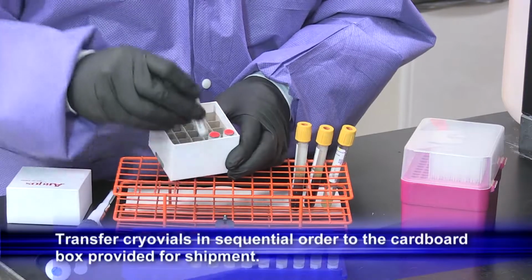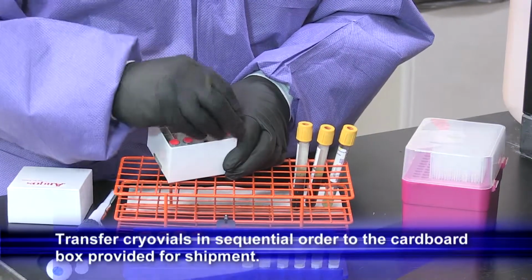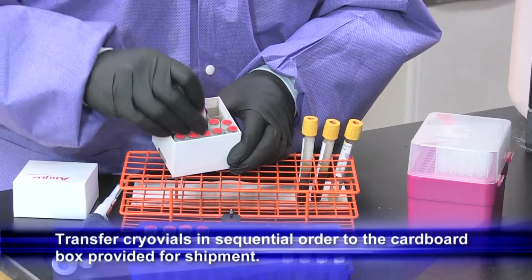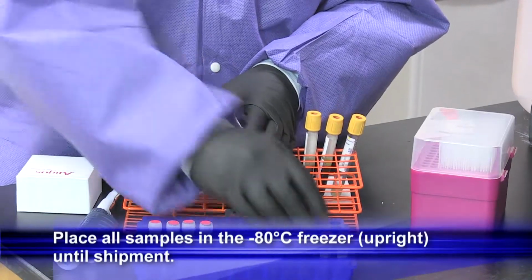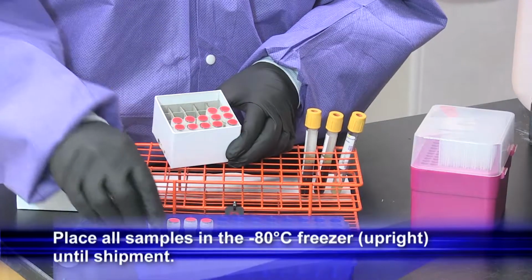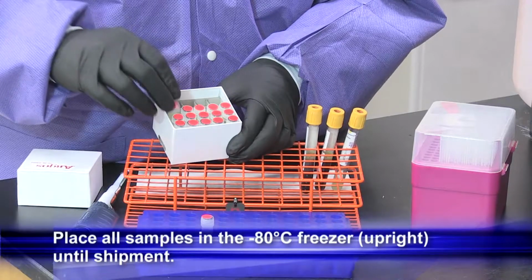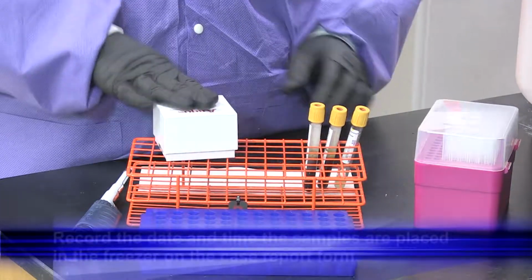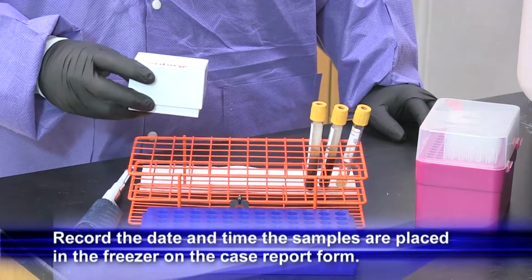Transfer the cryo vials in the sequential order to the cardboard box provided for shipment. Place all the samples in a -80 freezer until shipment. Place the samples upright while holding in the -80 freezer. Record the date and time the samples are placed in the freezer on the case report form.